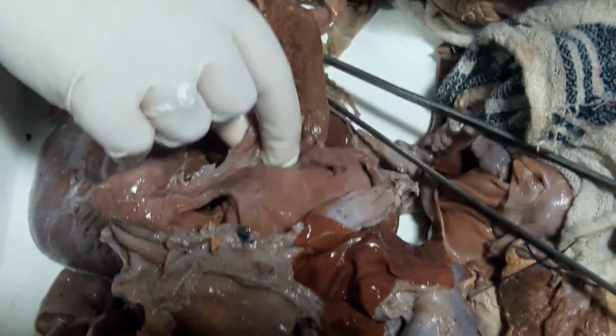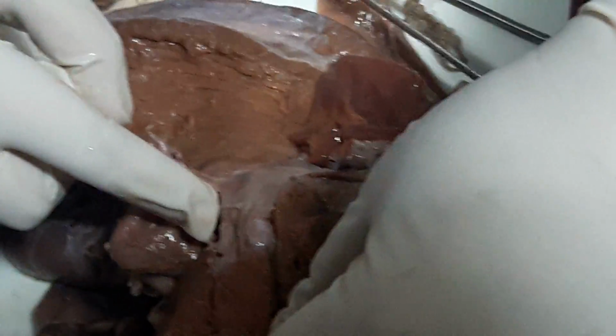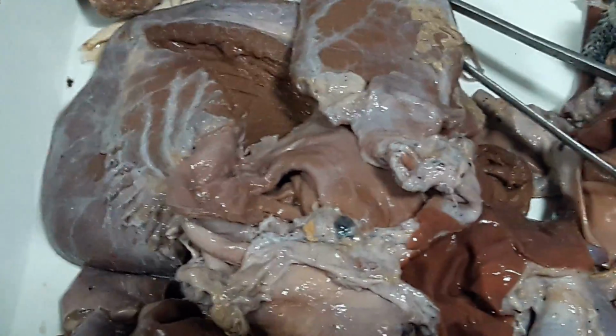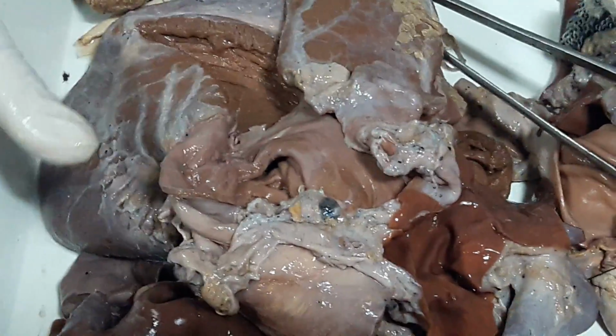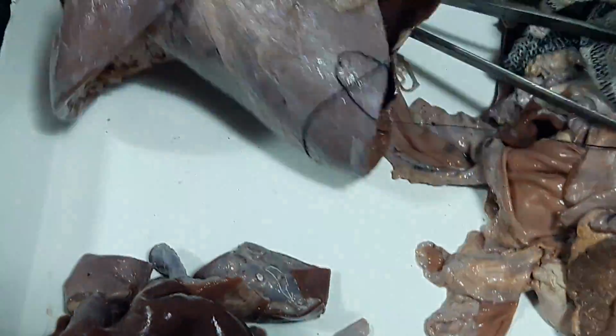Okay, and mitral valve is thickened. Okay, chordae are also shortened. Okay, so there is a condition where you get interatrial septal defect with mitral stenosis, and the condition is known as Lutembacher syndrome. Okay, so this is a case of Lutembacher syndrome.